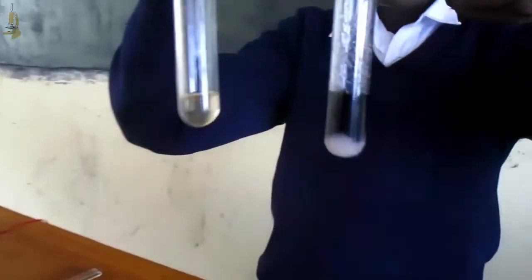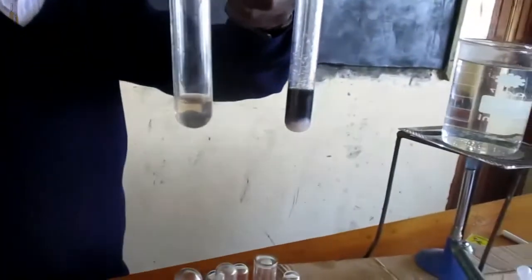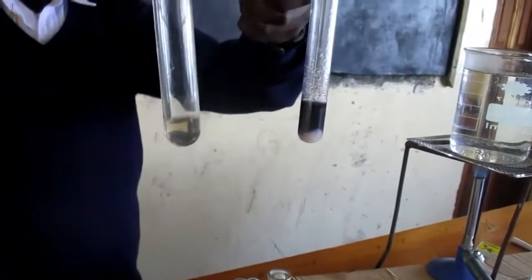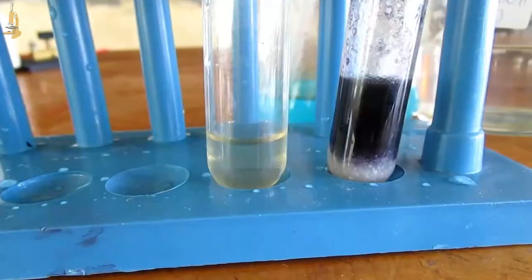We are going to check and observe. You can see our food sample B contains the dark blue color and our food sample C does not change color. This means our food sample B has the presence of starch.